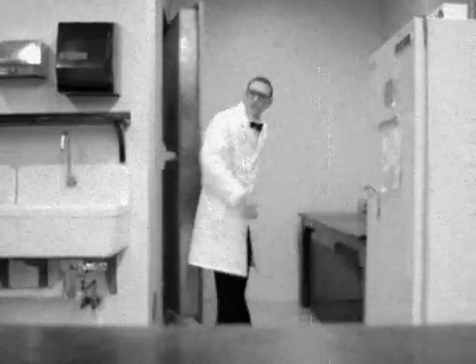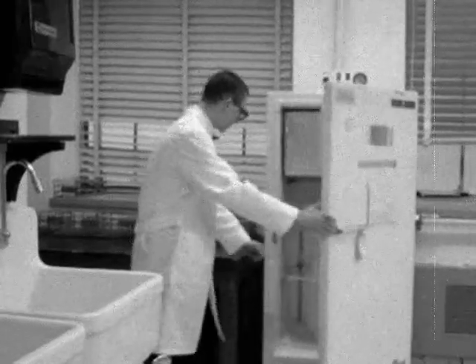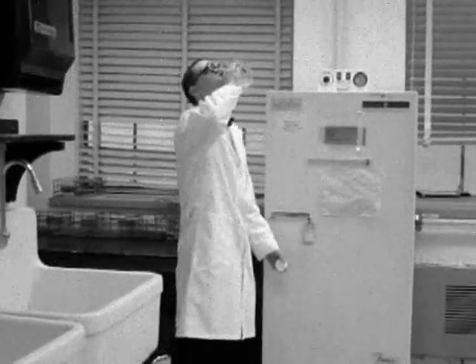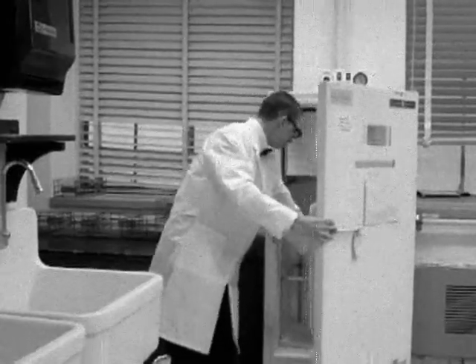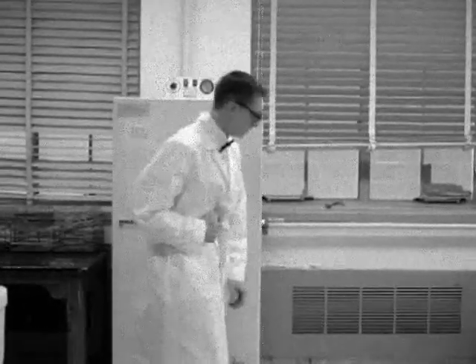But here comes Jerry. He looks thirsty. He can't find a drink anywhere. Hey, that might slake his thirst. No one's looking. Hey, Jerry. That wasn't lemonade. That was our friends the bacteria. And golly gee, are you gonna feel it.